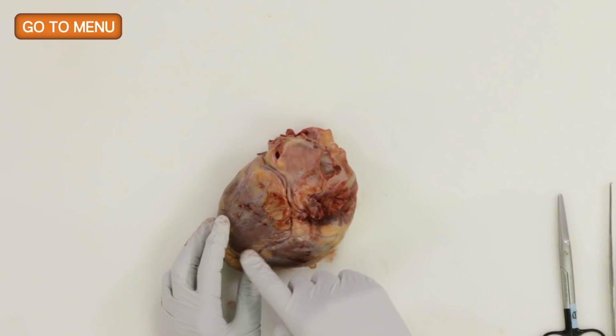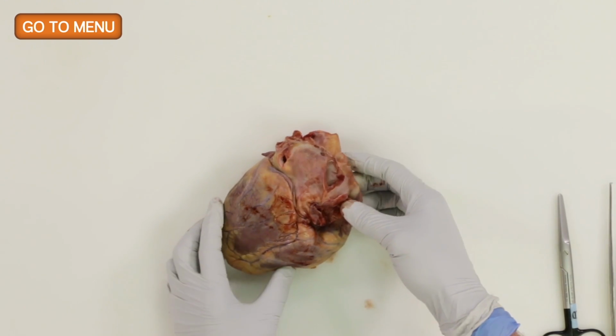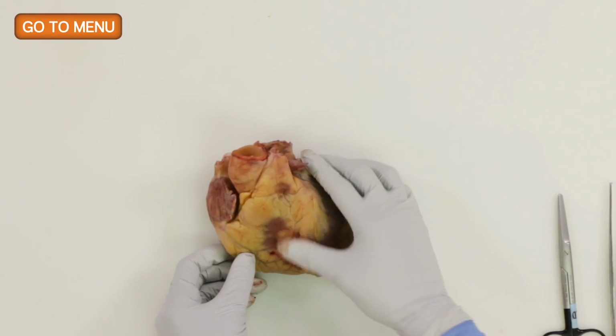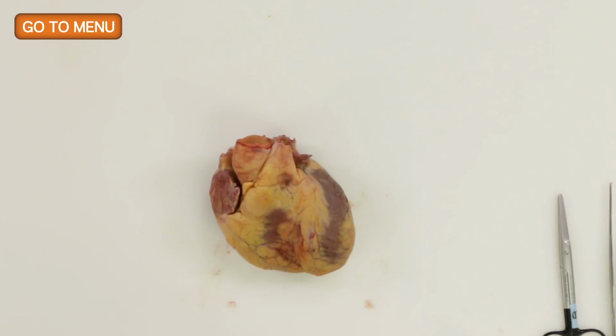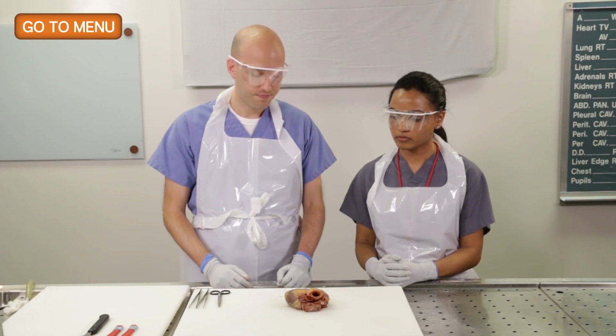The right coronary is coming along like this, but we'll find out because we're going to remove the coronaries to best evaluate them. All right, so return it to the anatomic position, and this would be the patient lying down, their head up here, feet down here.